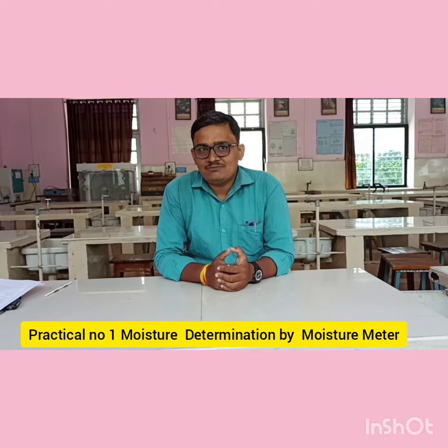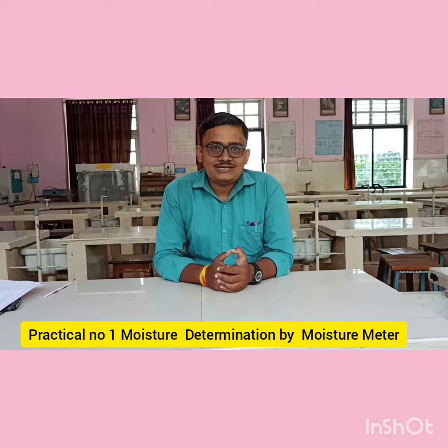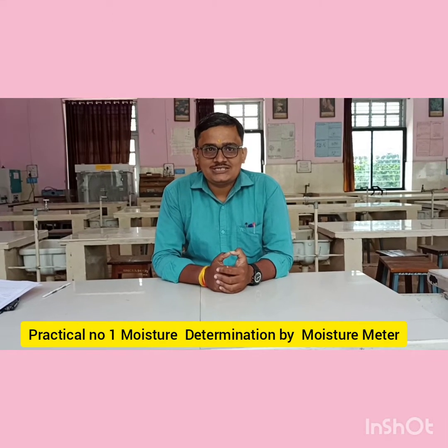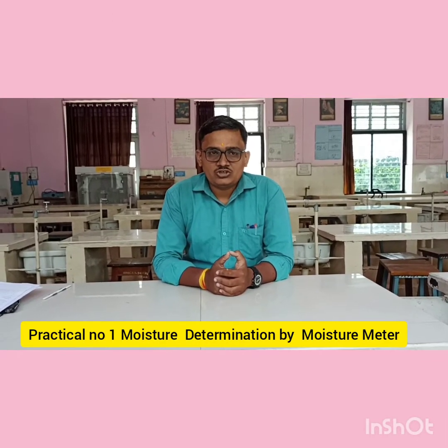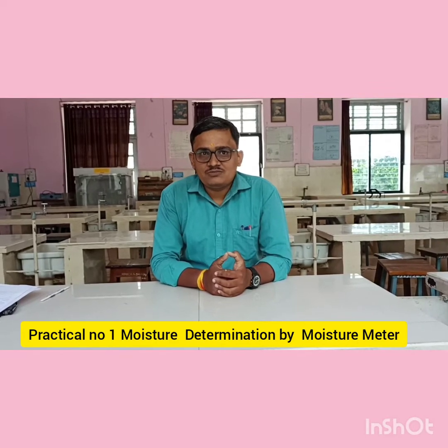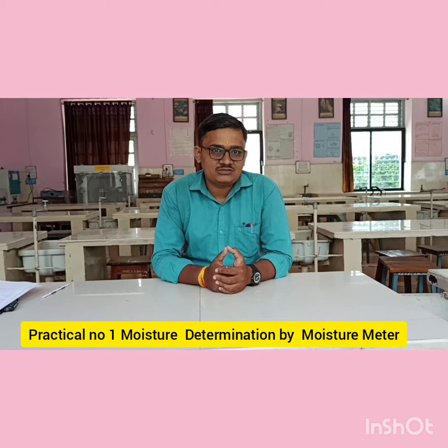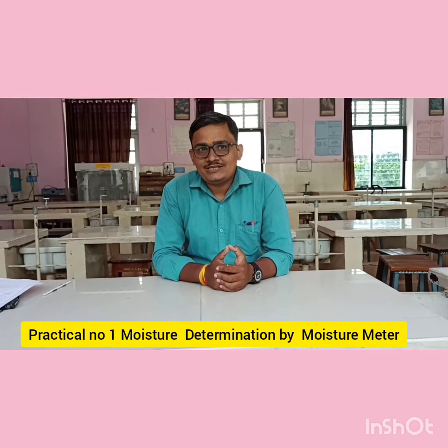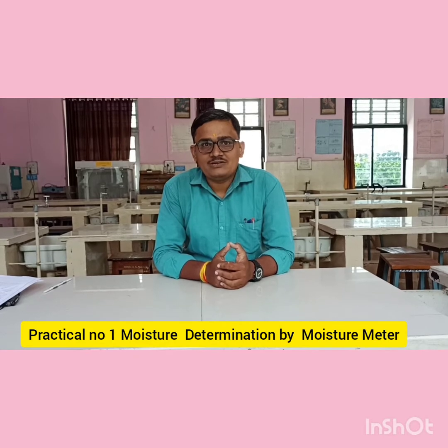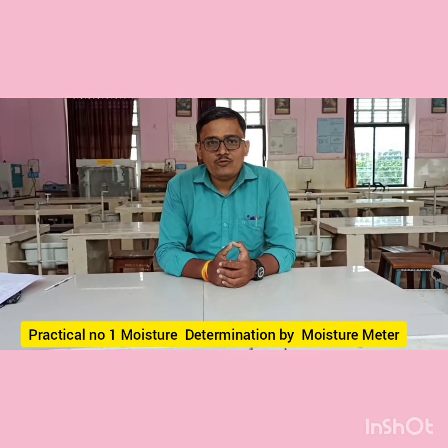I am the practical conductor of course number VOBT 234, that is Seed Science. In Seed Science there are 10 practicals. From today we are starting the demonstration practical, that is practical number 1: moisture testing according to the moisture meter and the hot air oven method. The aim of today's practical is the determination of moisture of a seed by the moisture meter and by oven methods.